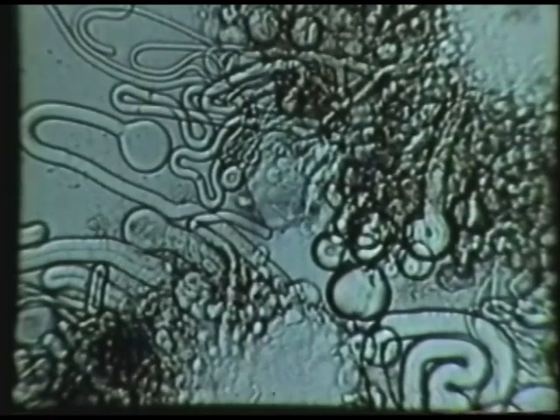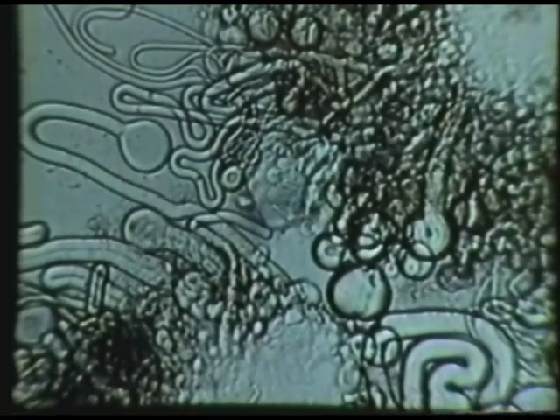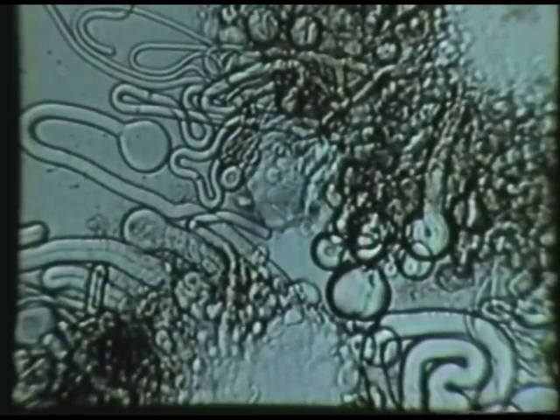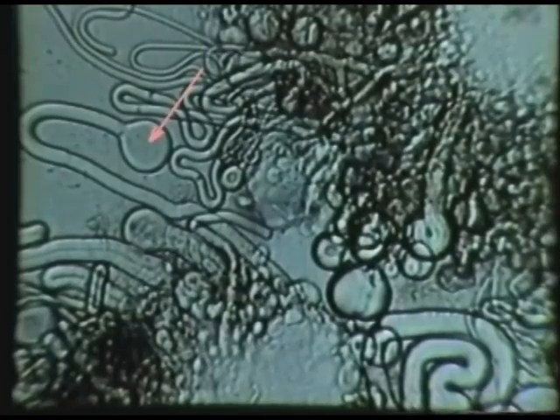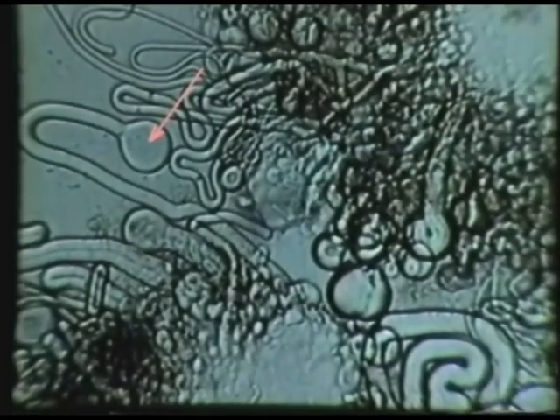Myelin figures develop when certain lipids, such as phospholipids and soaps of long-chain fatty acids, are exposed to water. They appear under the light microscope as cylinders and spheres of different sizes. The spheres are sometimes located at the ends of cylinders.